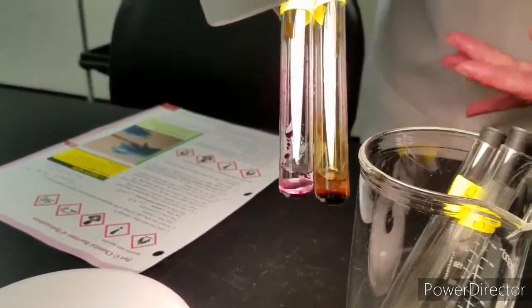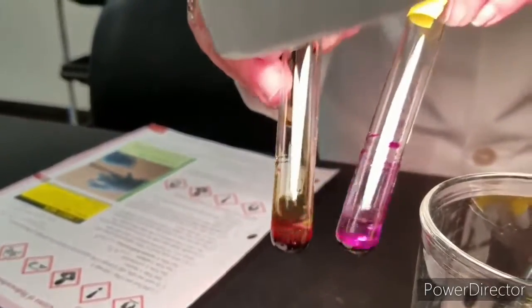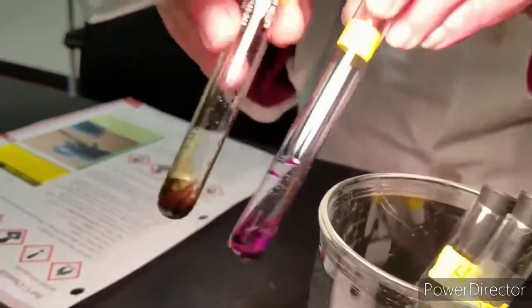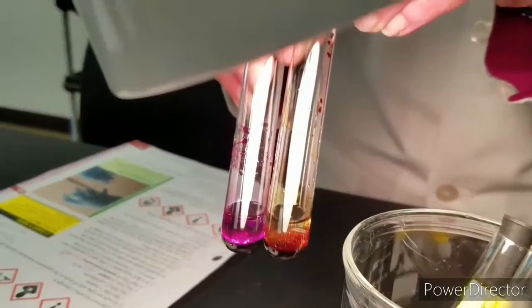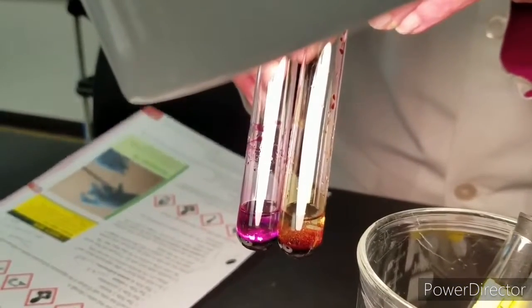Hexane and cyclohexene under the light. Hexane has purple, whereas cyclohexene has brown. Then the other 2 test tubes, unknown A is purple, and unknown B is brown.